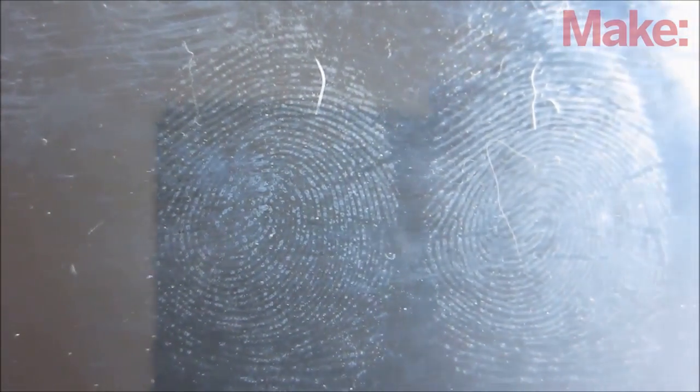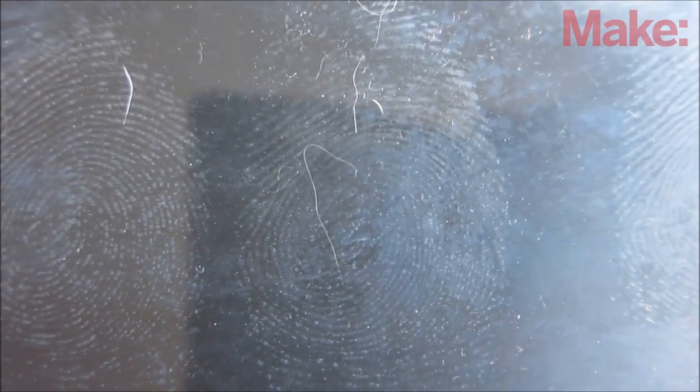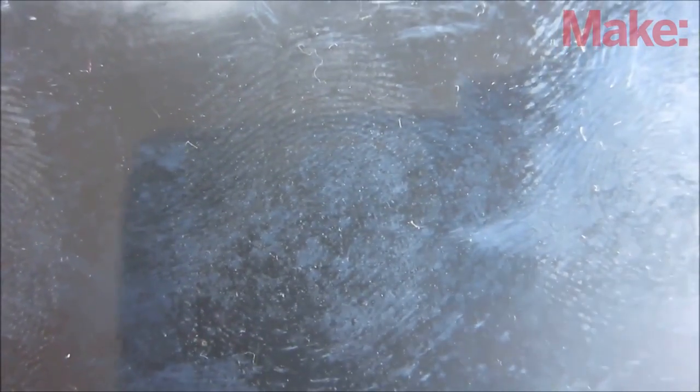It should take about 10 to 15 minutes for the superglue fumes to react with the chemicals in the fingerprint, and leave a white outline of the impression.